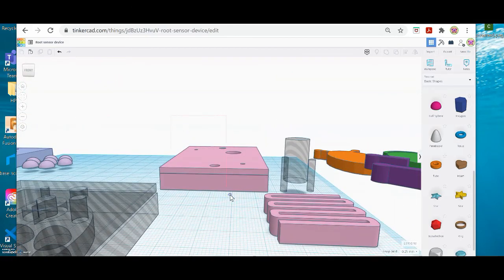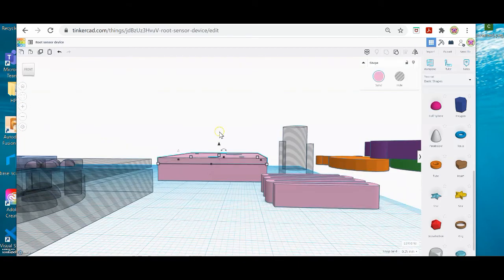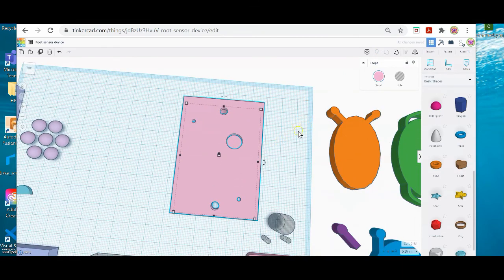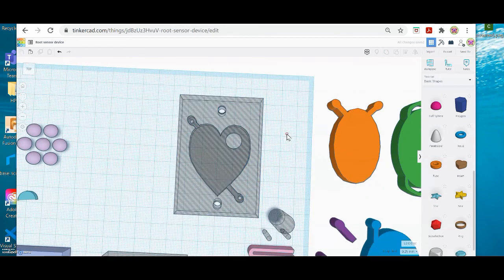And then my last step is to make sure that my lid is actually attached to the base. So I just want to make sure that they are overlapping slightly or together. Okay. And now I'm going to draw a selection box around both of those and go up to group. I'm going to reorbit, and it's kind of hard to see right now because it's solid, so I'm going to turn everything into a hole, and now I can see my final design.